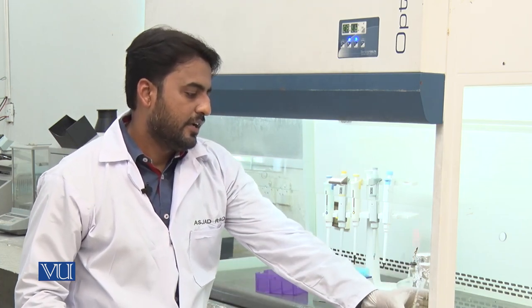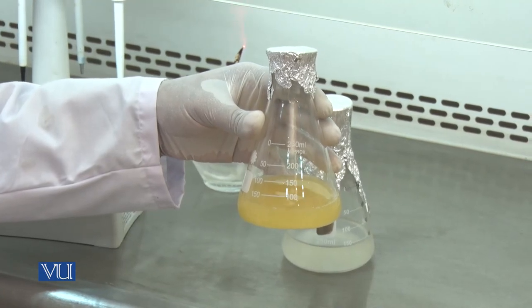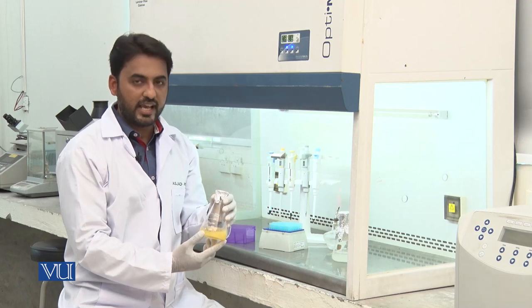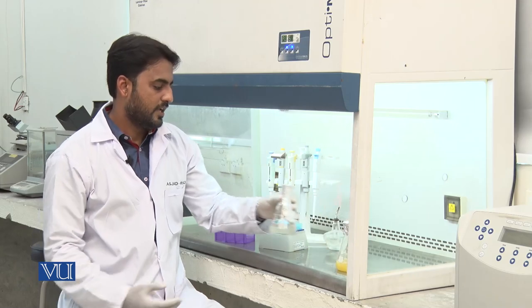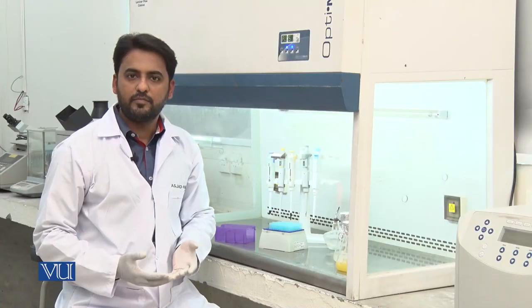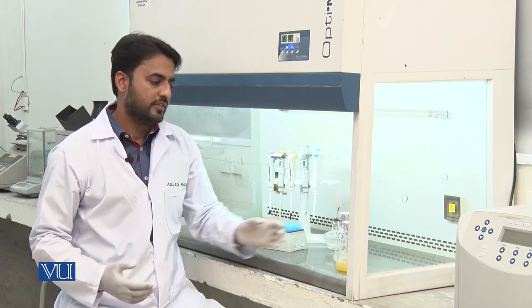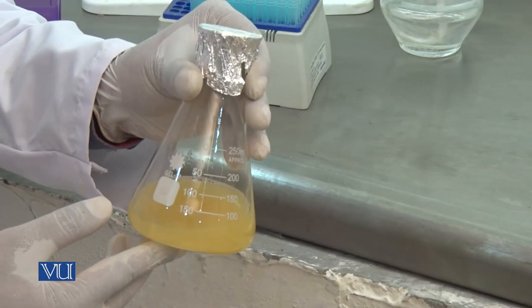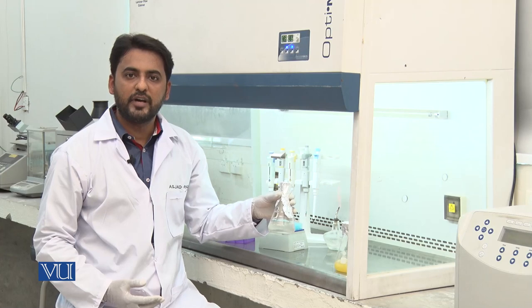Let me first introduce the chemical apparatus which we will use in this experiment. Here we have the vegetative culture of bacterial microbes which we will use as inoculum. In this flask I have 100 ml of fermentation media. In the very first step, we will take 1 ml of this inoculum and transfer it into the fermentation media with the help of a micropipette.